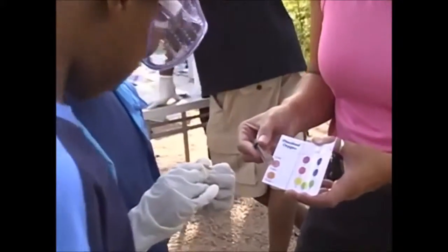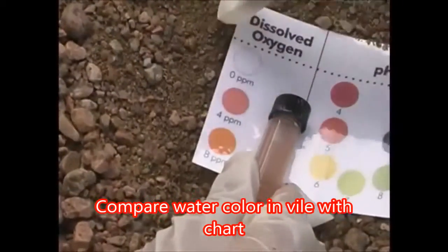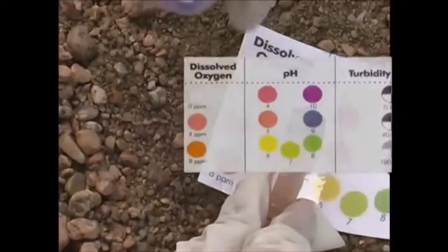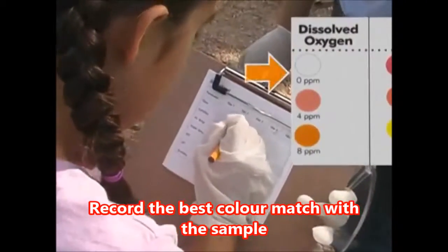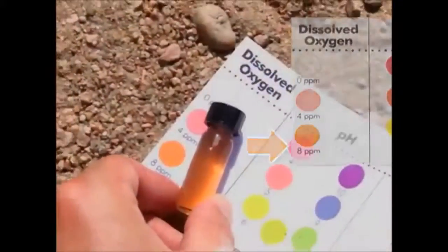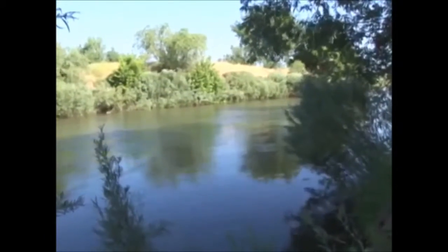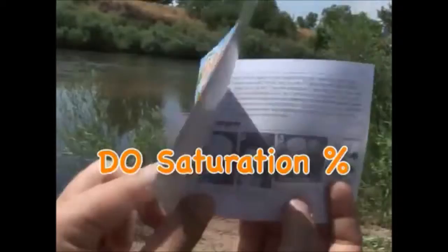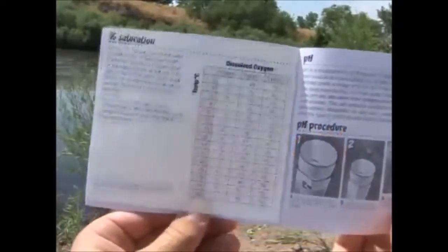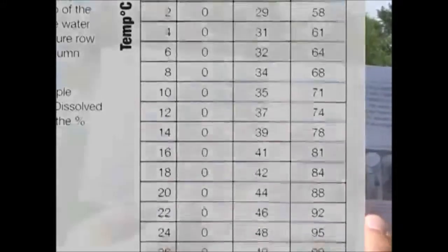Now compare the color of the water with the dissolved oxygen chart on the card. Select the color that most closely matches your water sample and note the value, 0, 4, or 8 ppm, or parts per million. The higher the number, the more dissolved oxygen is in the water. Since the water temperature affects the ability of oxygen to dissolve, you will also determine the DO saturation percentage, using your results from these 2 tests and the chart in the test kit manual.